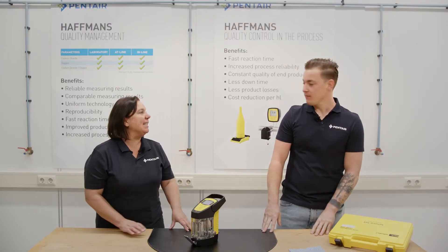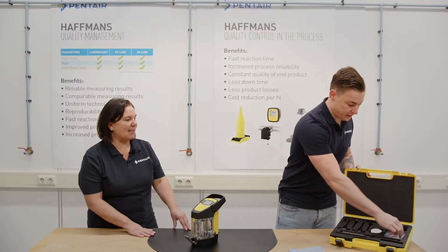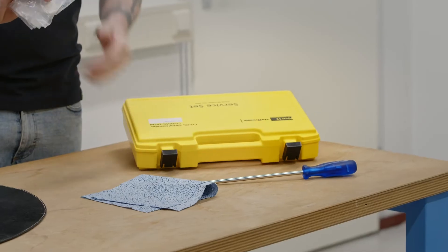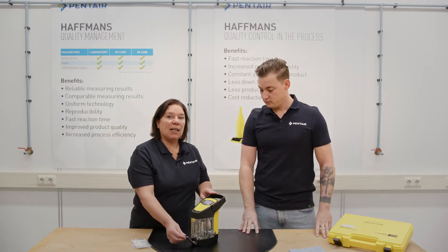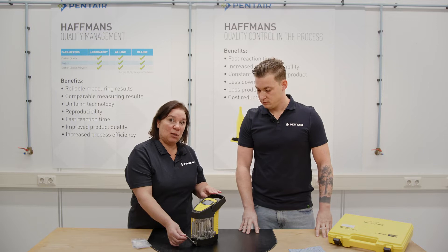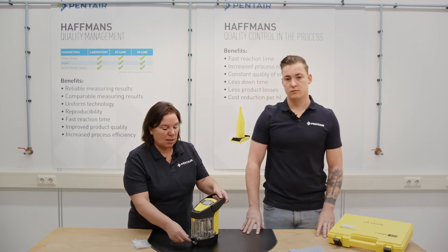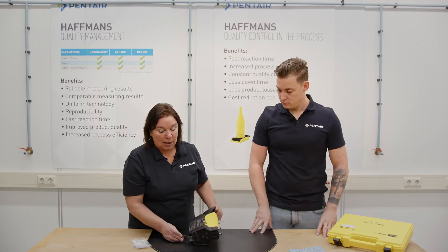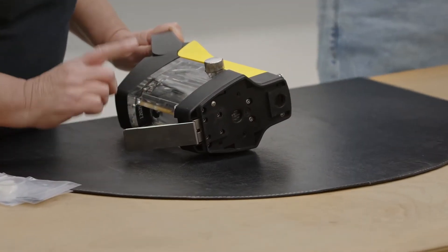Let's begin. What kind of tools do we need? Mainly the keys are present in our service set, including the set of o-rings. For good, well-maintained plunger functioning, it is better to check regularly if the plunger is clean. You can easily open the plunger by unscrewing the four screws that attach the plunger onto the meter.